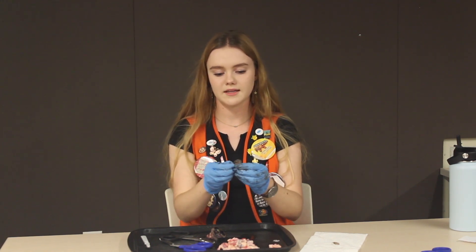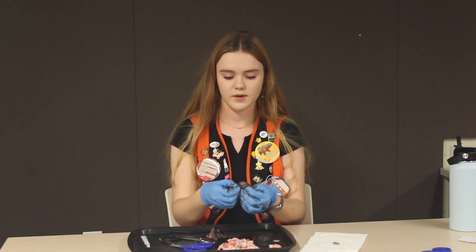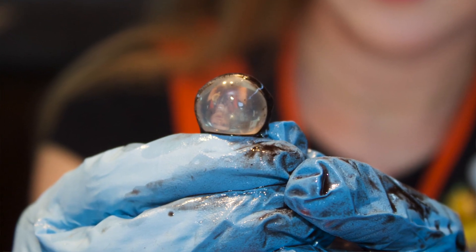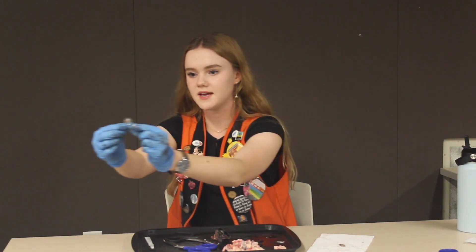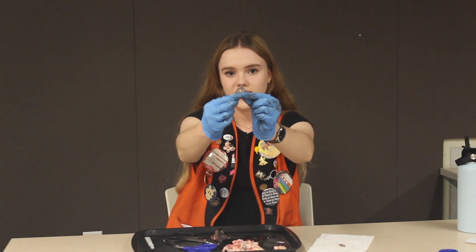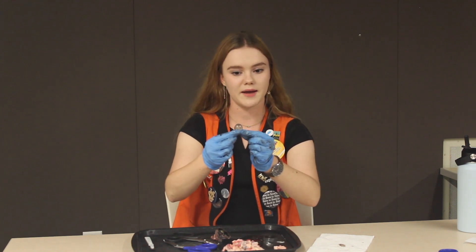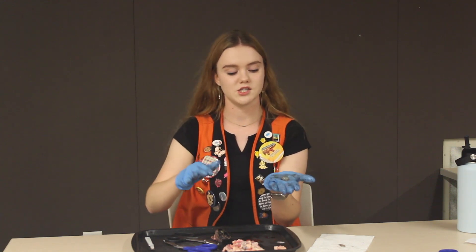It's going to be really delicate because the lens is fragile. Peel it all away. So I've peeled away the lens from the body so we're just holding the lens now — I like to grab it with four fingers and prop it up. If you have an audience you can hold it up to them and ask why don't you look through and tell me what you can see. What they should say is they'll see you upside down and backwards, because everything we see is actually upside down and backwards but our brain flips the image and gives it in the right orientation.